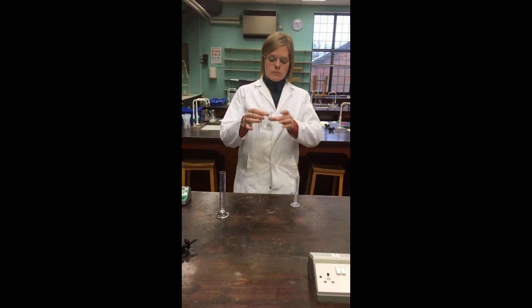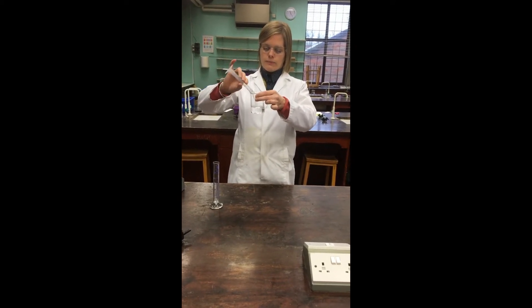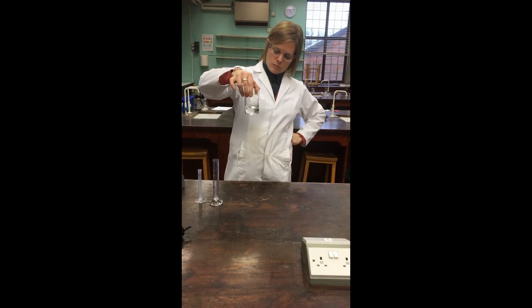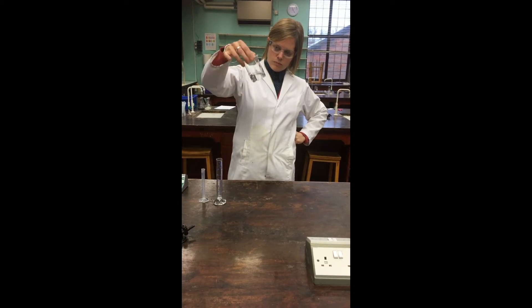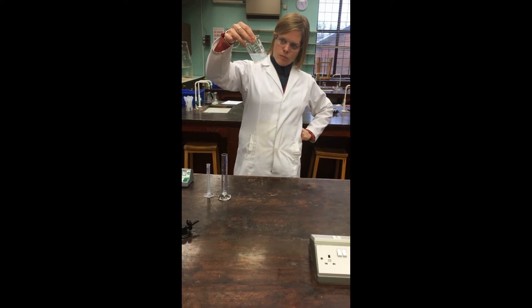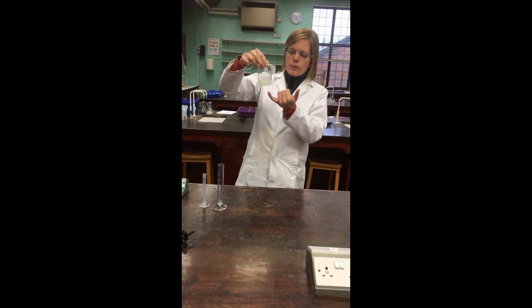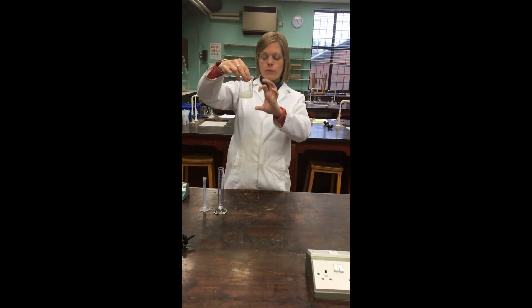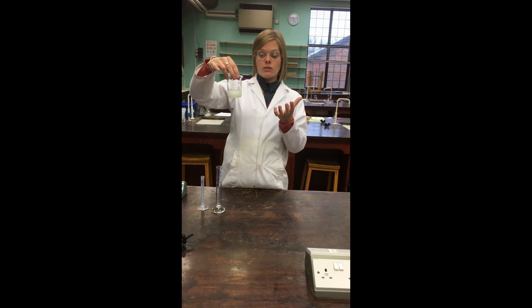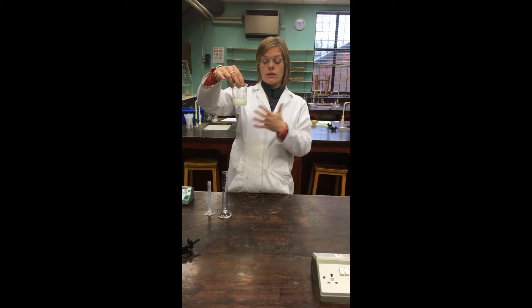In this beaker I've got some sodium thiosulfate solution, and I'm just going to add to that some hydrochloric acid solution to see what happens. This is a reaction where we could adjust how we set it up in order to provide something we could measure to deduce the rate of reaction, or at least compare rates of these reactions with different concentrations and different conditions.